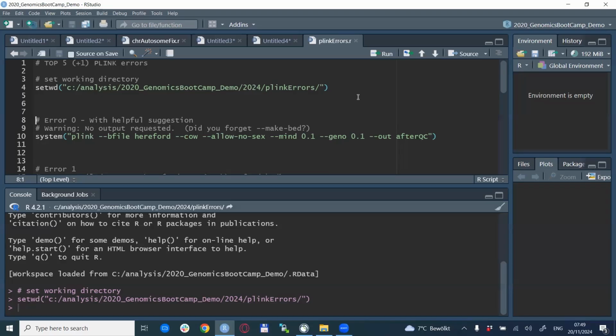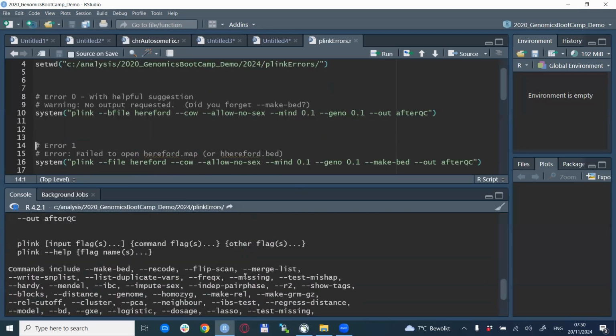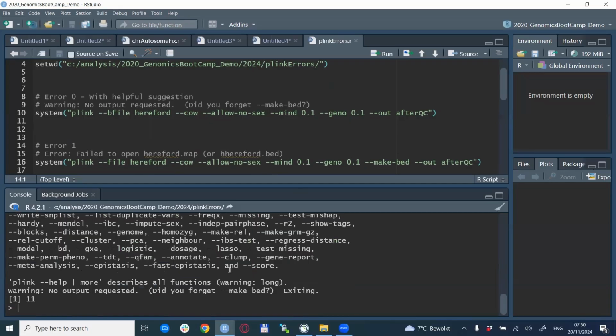The first one is already the bonus error that I want to show to you, and also because this is one of the exceptions, I would say, that actually provides a suggestion. The error that you get is the following: a warning, no output requested. Did you forget --make-bed? When we run this, this is how the error looks. There is a bunch of commands shown, and basically this is the warning message if we forgot --make-bed or any other option that actually requests some kind of output.